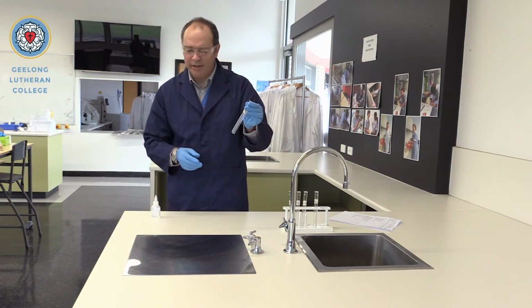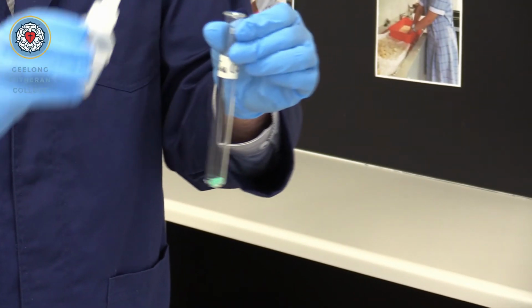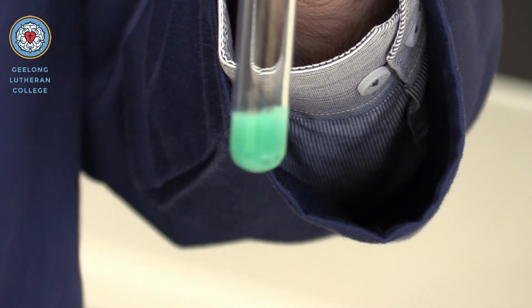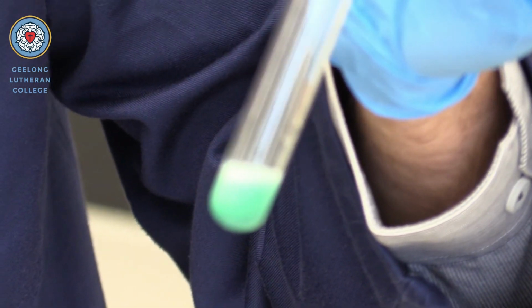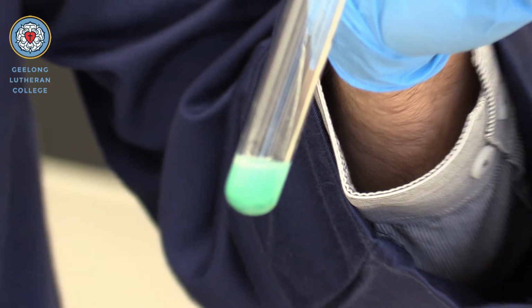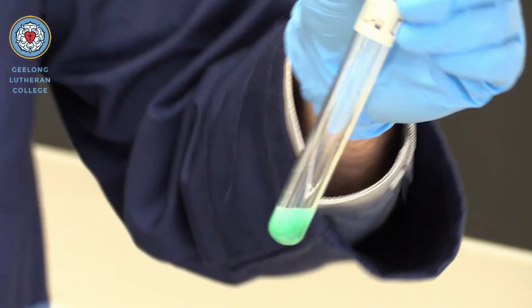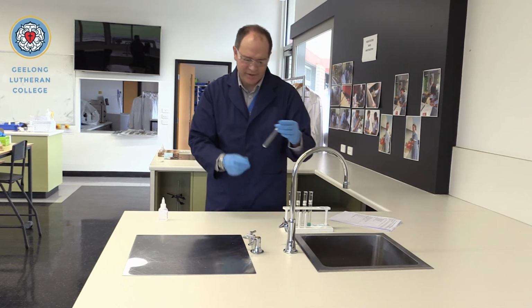Okay, we've got a bit of copper carbonate now. Slightly different colour there because it's got copper in it, but copper carbonate, again, we'll be looking to see if gas and bubbles are released. Bit slower to get started, but yes, we can see now that it is bubbling away there, producing some carbon dioxide. Not as vigorous as the first 3 that we just checked, but definitely evidence there that carbon dioxide is being produced.